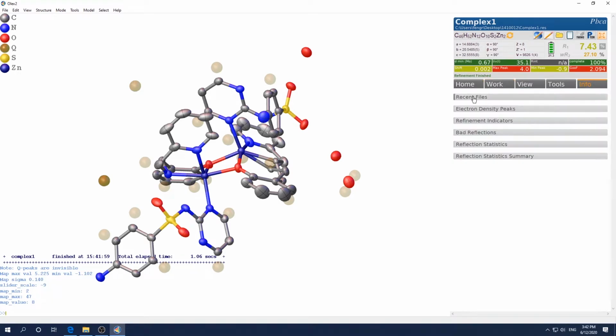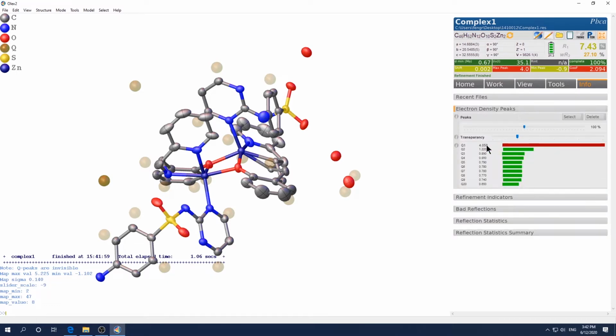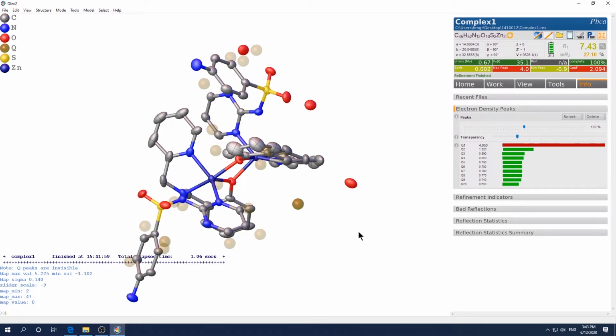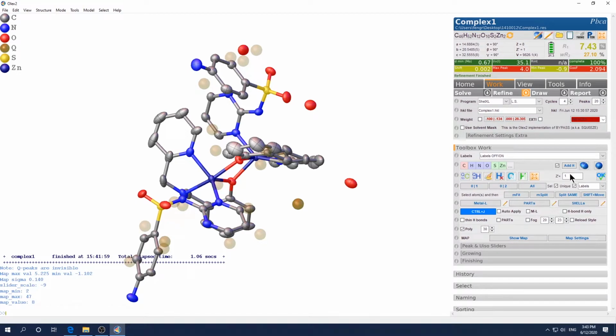Then we want to see the rest of the Q peaks. So electron density peaks. So there's only one huge peak there. What's the second peak? Q2. Let's select Q2. Okay, it's here. Then the next step is to add hydrogen. So again, adding hydrogen could be realized in two ways. Either you click add hydrogen here, and then we'll refine if you have this checked, or I prefer just HADD. It's the same thing.